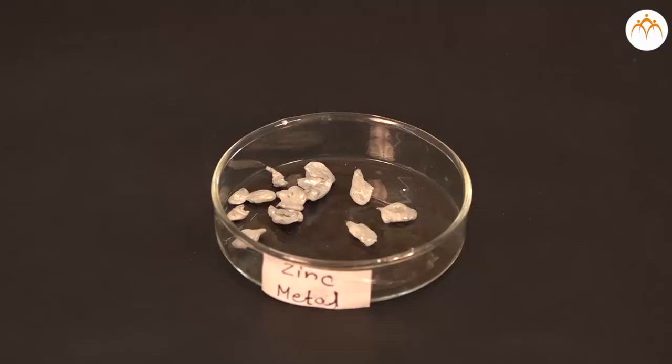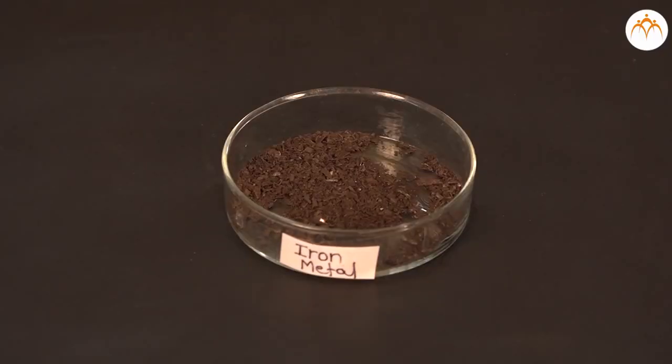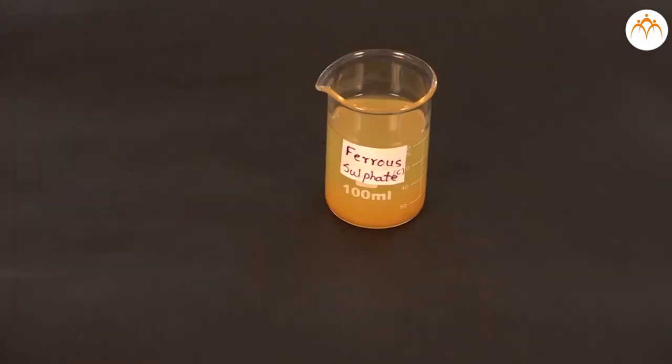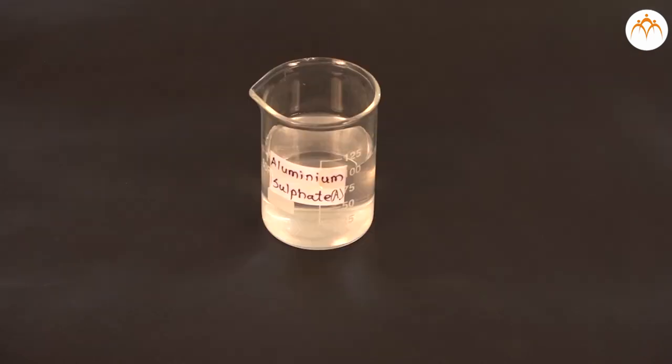The aim of the experiment is to study the reactions of metals Zn, Fe, Cu, Al with the solutions of salts ZnSO4, FeSO4, CuSO4, Al2(SO4)3.